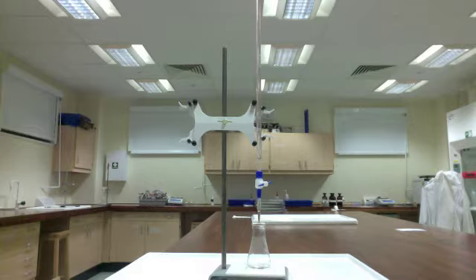There are two solutions involved in a titration. The solution that's placed into the burette, which in our case is sodium hydroxide, is called the titrant. The solution that's placed in the Erlenmeyer flask is called the sample. We're going to look at two different types of titrations: standardization, and then sample analysis. I'm going to look at standardization. You guys are all going to do the sample analysis.